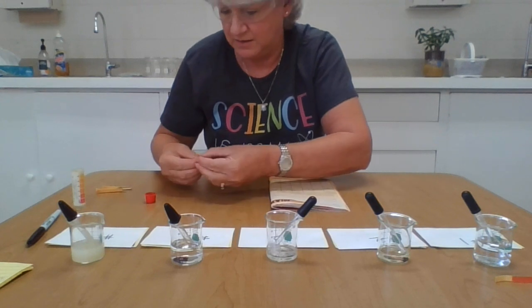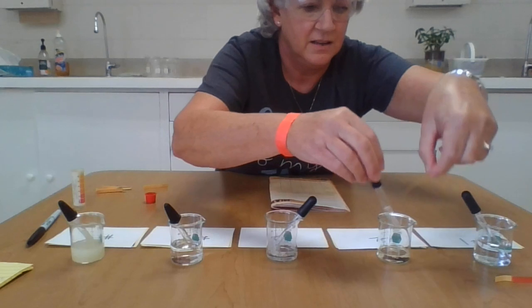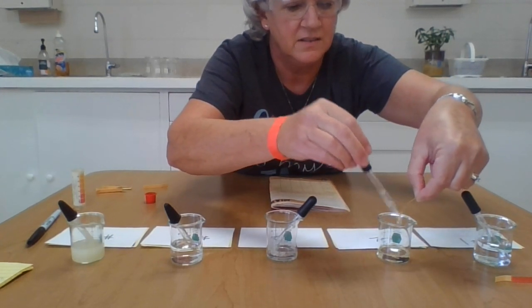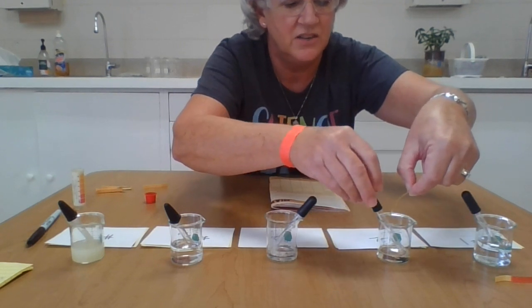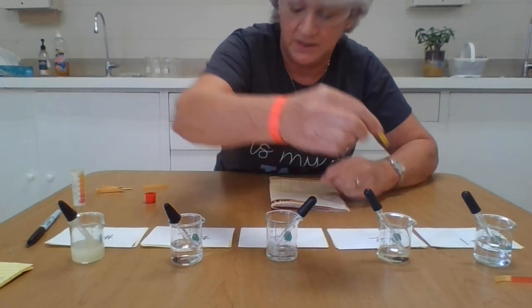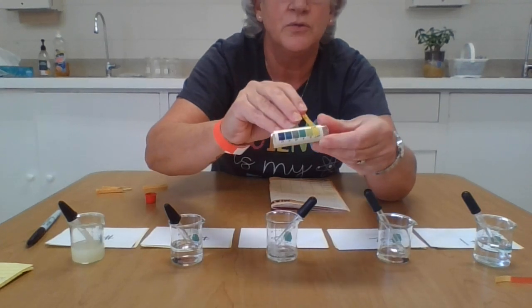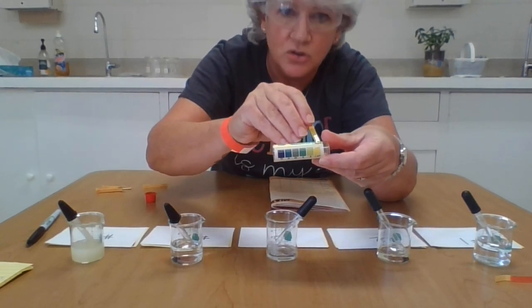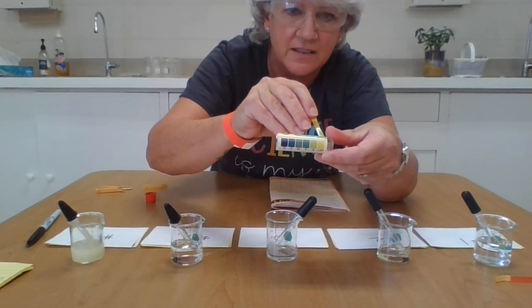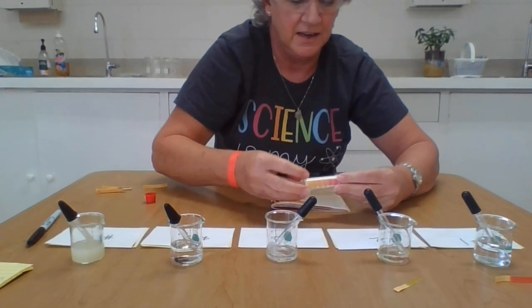All right, the second substance is this thicker one. And I think you can kind of see, it changed right away as well. These should change pretty quickly. It's not like you have to test them and let them come back and see what they were. If I hold it up to my key, it is a perfect match to number 7. So that means it's neutral because it's not to the acid side or the basic side or the alkaline side. Okay, so that would be a yellow color and a pH of 7.